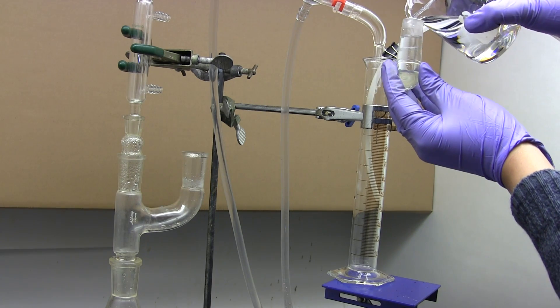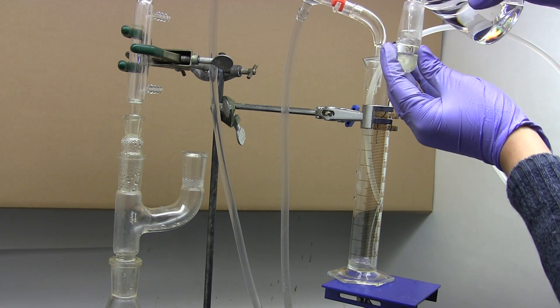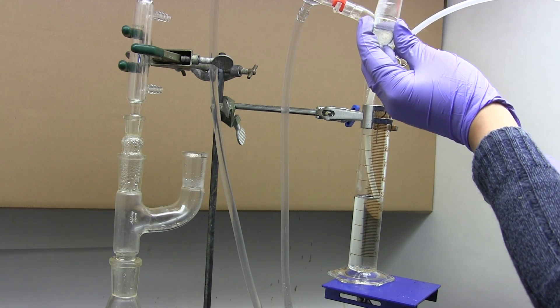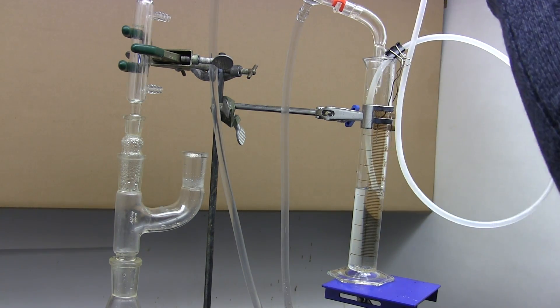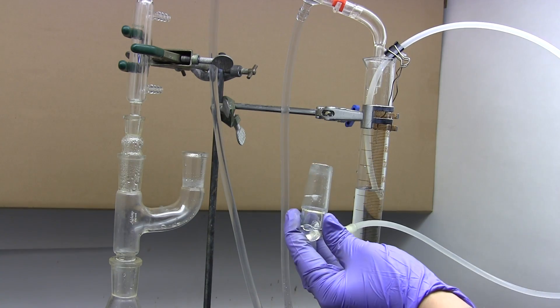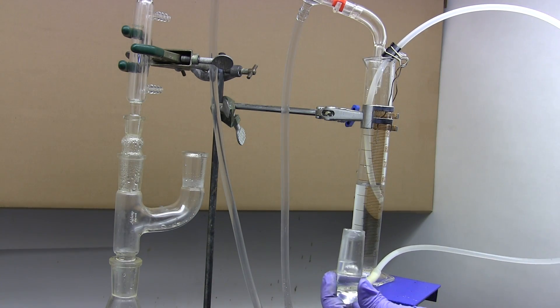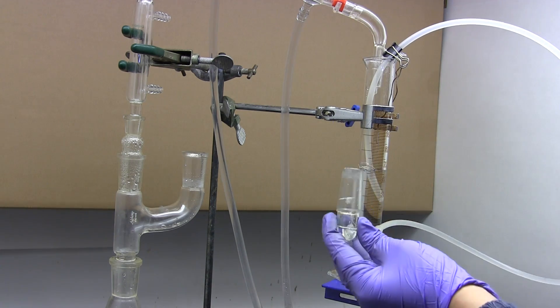Since we want to collect water, our carrier fluid is toluene. I'm filling through the hose adapter here but you can use whatever method you want. Fill up the graduated cylinder until it's past the tube inlet. Now make sure the tube itself is filled without air bubbles in the top. You may have to move around the tube somewhat to work the bubbles out.